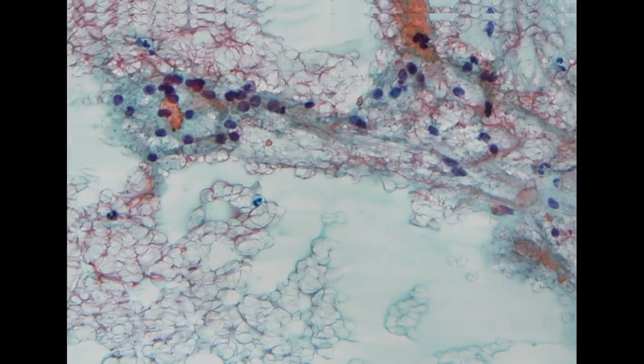We only see the colloid, so this looks like a benign nodular goiter, with benign-looking follicular cells. However, the lab told me that these came from two different shipments of specimens, and the preparation was performed at different times. One is from the outpatient, the other from the inpatient, so there is no way clinically that they could mix the specimens. So it was a very unusual situation.